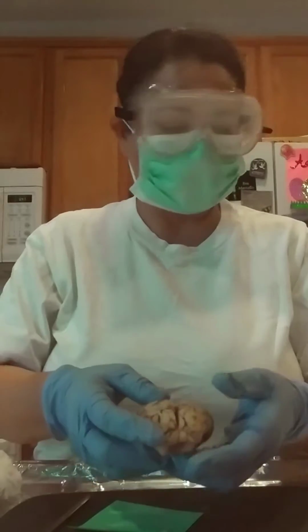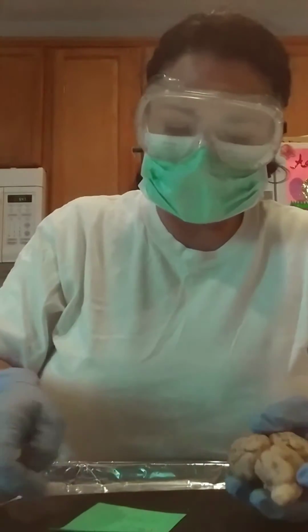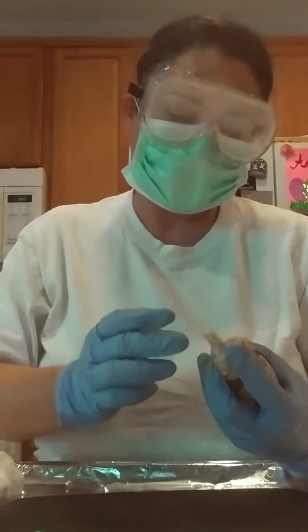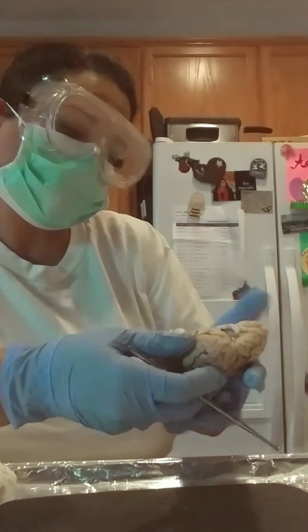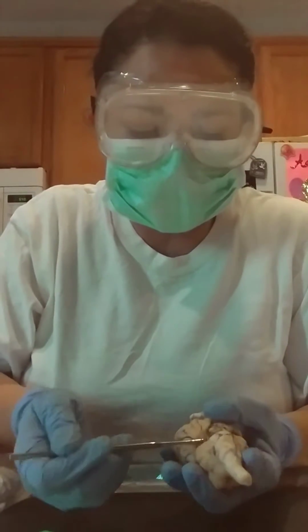Okay. Now I wanted to show you some of the nerves that are located here. Let's see if I can, I know that, let me see. Okay, so here's one of the nerves here.